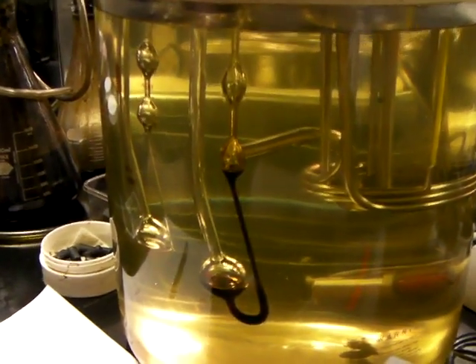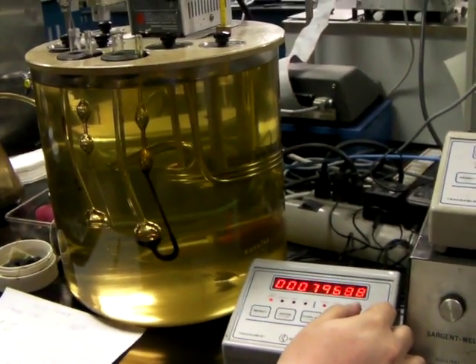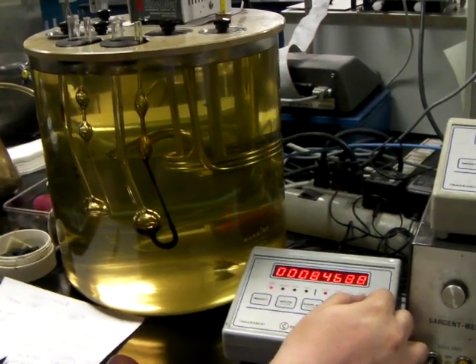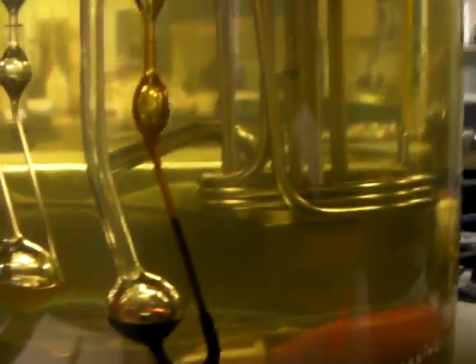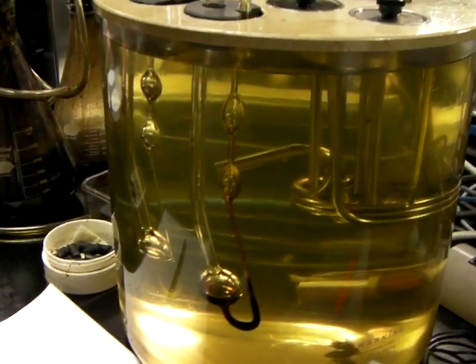There's a little red line — I doubt very much it'll show up on the camera. It's a little red line that you need to look for. And this oil bath is at 40 degrees C. And this one over here is at a hundred. And then you calculate the viscosity from that.